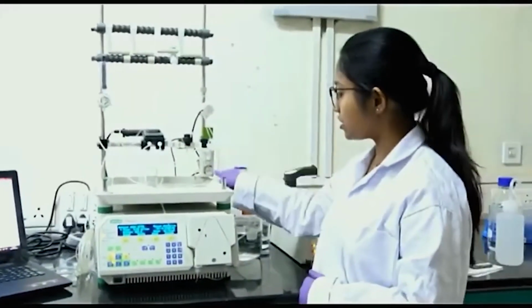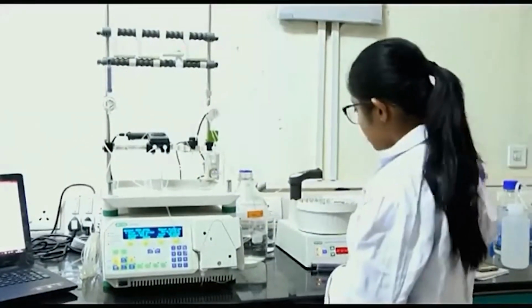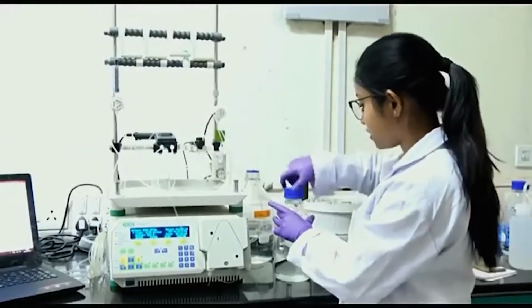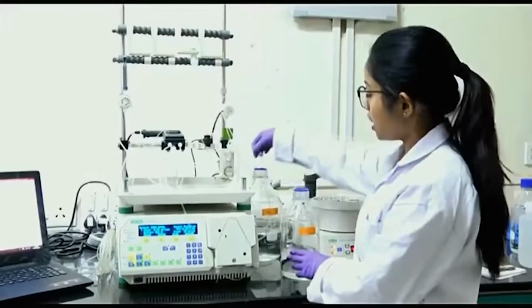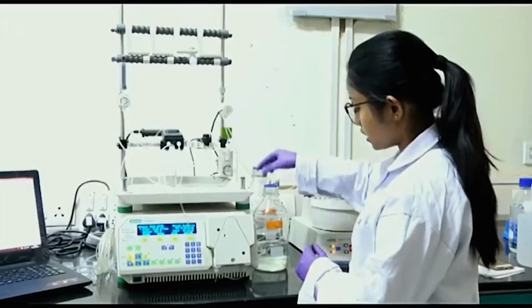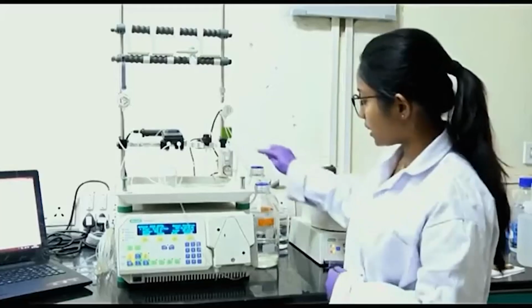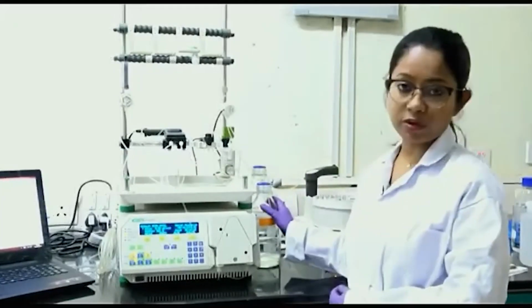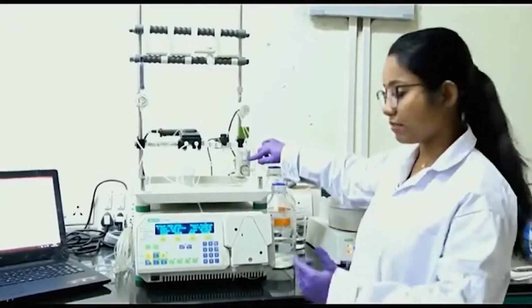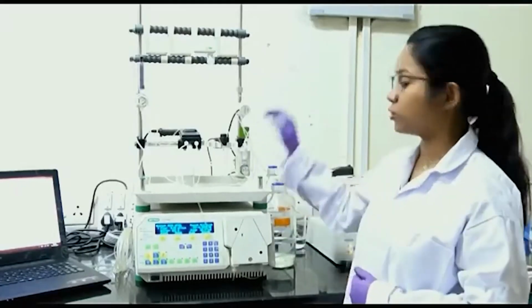Then, as I mentioned earlier, there are two inlets, buffer A and buffer B. Right now only buffer A was running. Now I will have buffer B as well, and I will take this buffer B inlet and put it inside the buffer B. So, there are two inlets. Now it will take a certain volume of buffer B. This is a mixer where it will mix at a proper gradient, which I will specify. It will mix and then pass that particular gradient buffer through my column.